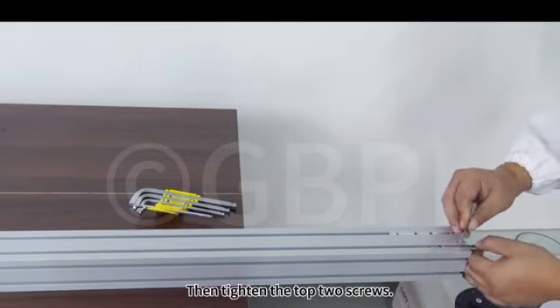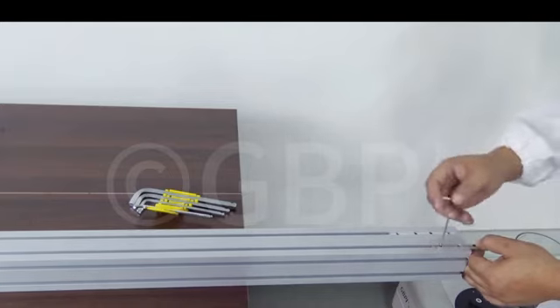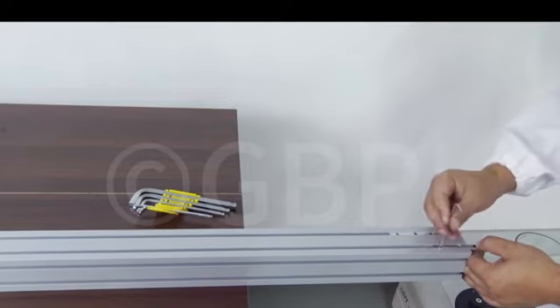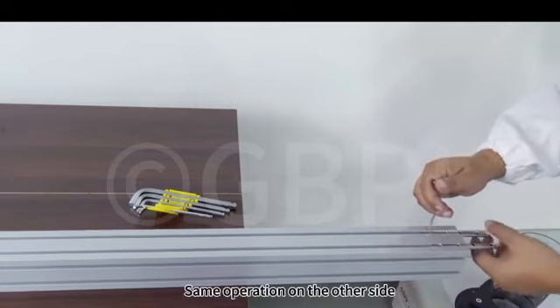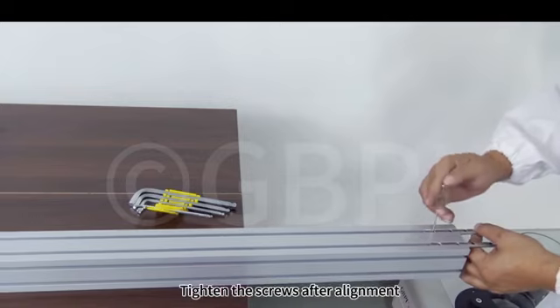Then tighten the top two screws. Same operation on the other side. Tighten the screws after alignment.